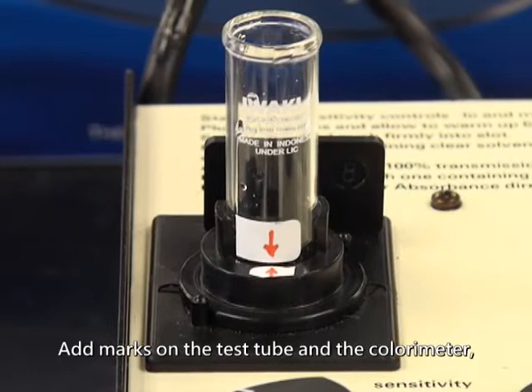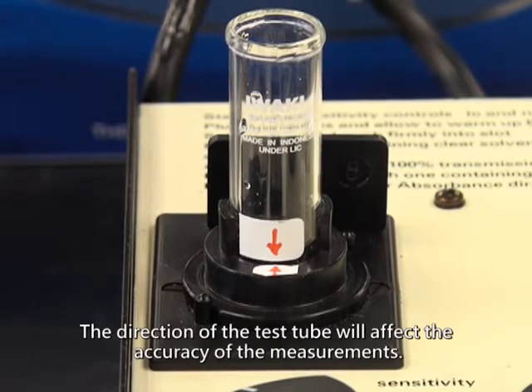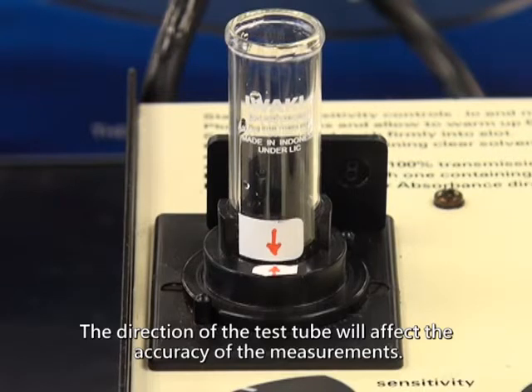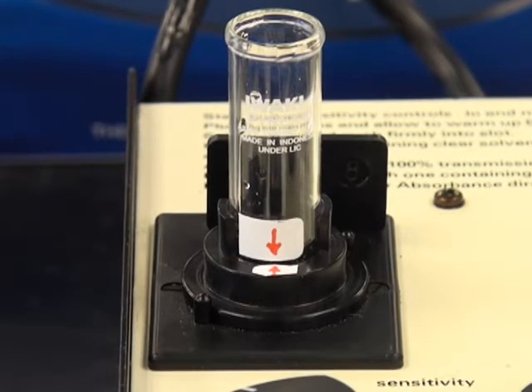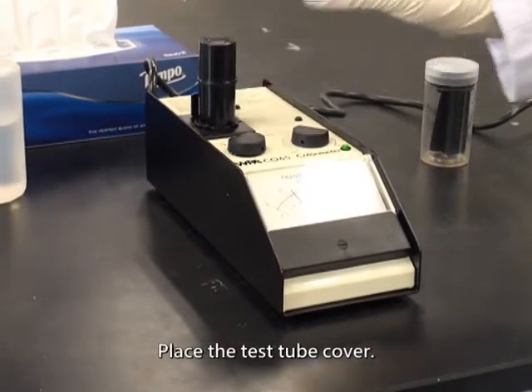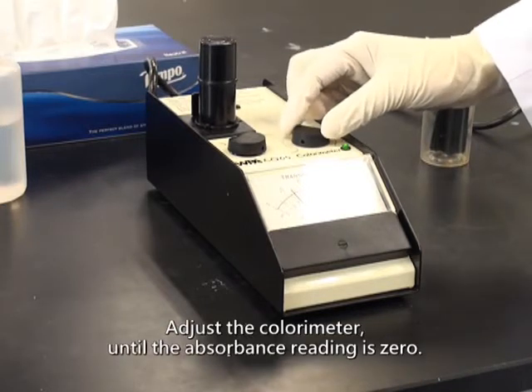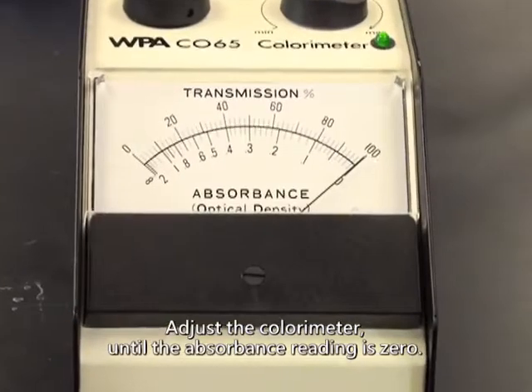Add marks on the test tube and the colorimeter to ensure the test tube is placed in the same direction in each measurement. The direction of the test tube will affect the accuracy of the measurements. Place the test tube cover. Adjust the colorimeter until the absorbance reading is 0.